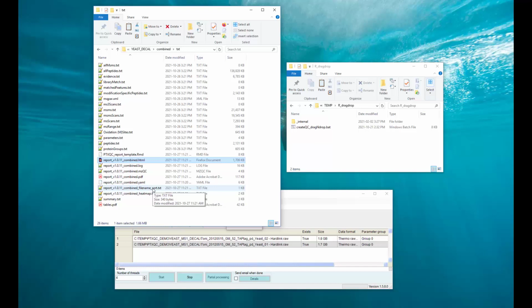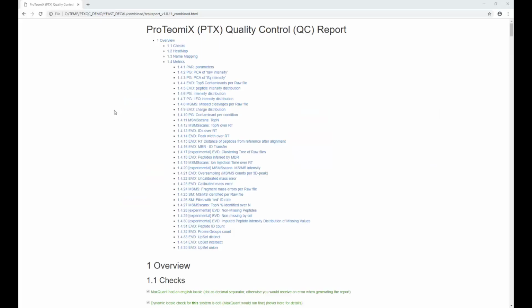Yeah, so that's basically it. So let's now jump into the report and have a look at it. So here I have the report pulled up, and the first thing you're going to see is basically an index which allows you to quickly jump to any part of the report, in particular to any of the metrics you can see here. So for this particular set of data, PTXQC generated 35 metrics.